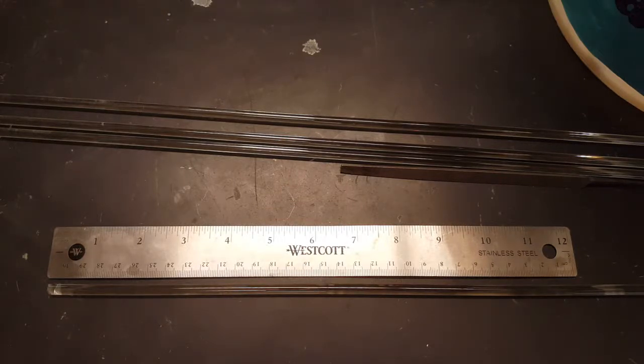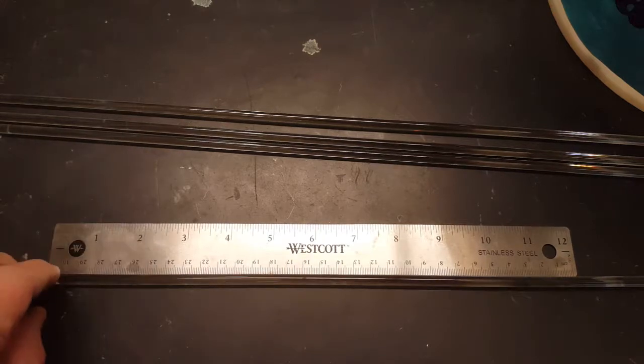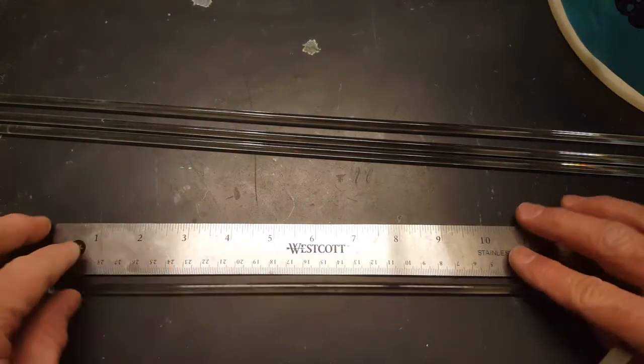This is a brief tutorial to help you make stir bars for our chemistry lab. On one of the middle tables we've got glass rods — they're like glass dowels — and we have steel files and rulers.